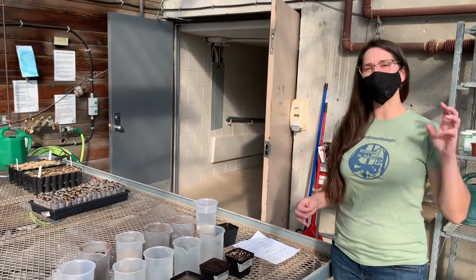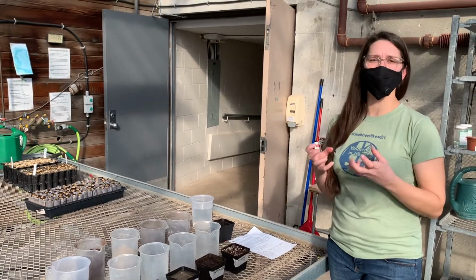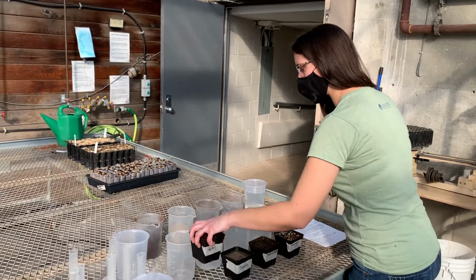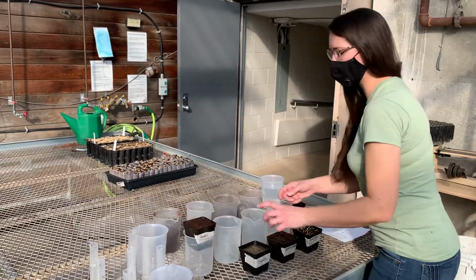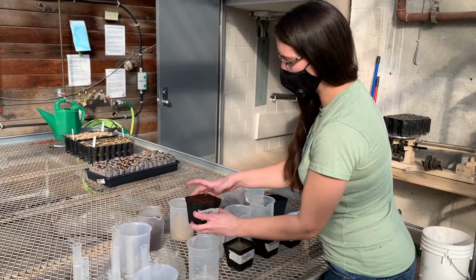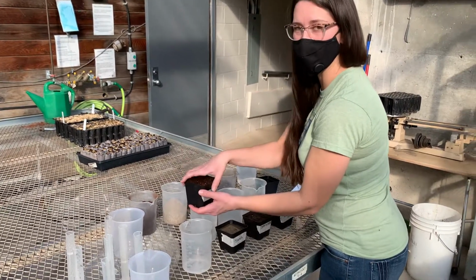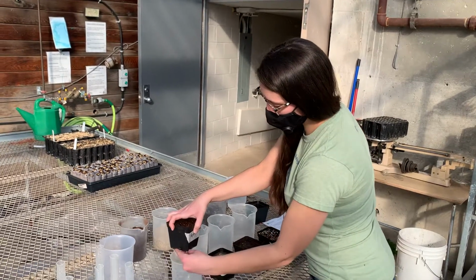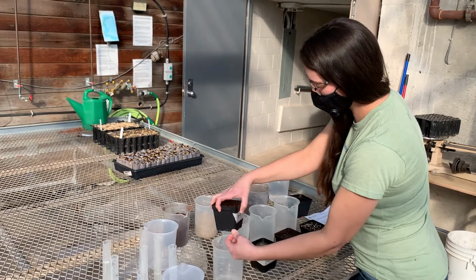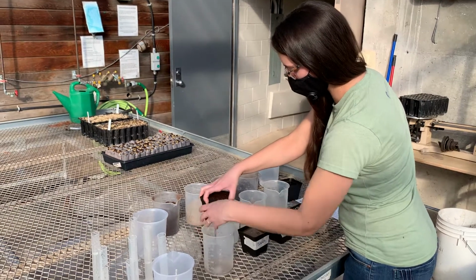So we can expect that some water that we put in is going to stay in the containers because it's now adsorbed or stuck to the outside of our particles. So the way to drain them, we're going to very carefully hold our pots over an empty vessel, and we're going to try not to squeeze them and not to tip them because we just want the gravitational water to fall out. So we're going to very carefully remove our high-tech pot plugs of plasticine and let the water drain out of there freely.